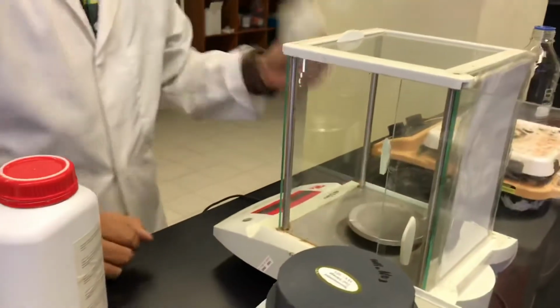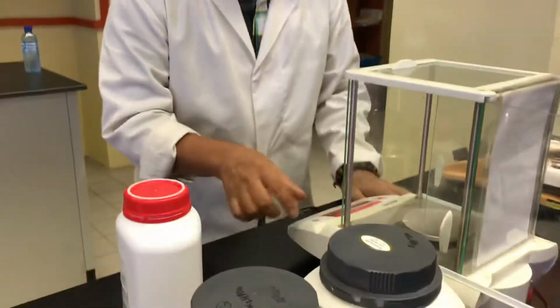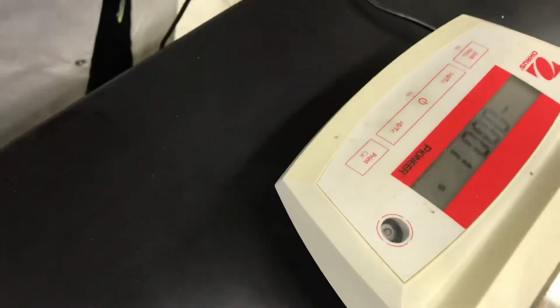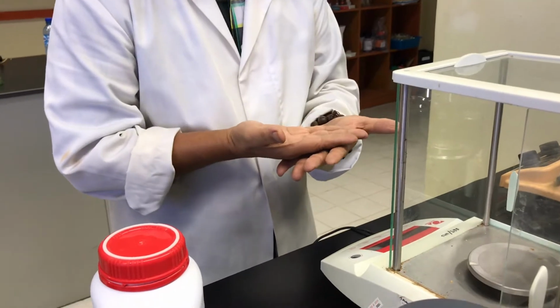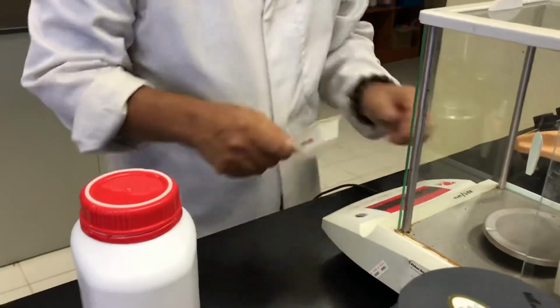So prepare 5 grams. Before using a balance, there's one thing you must really do. Make sure that you know this one. There's a level indicator; I don't know what you call it. You must make sure that the bubble is in the middle, just to make sure that it is really horizontal. If it is not really horizontal, it will affect the quantity or the reading, how much you put in. So I just show you.